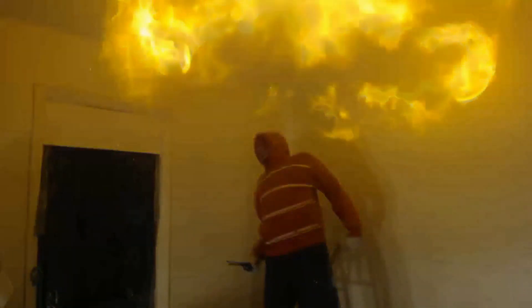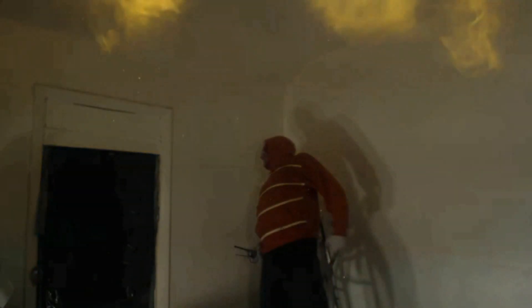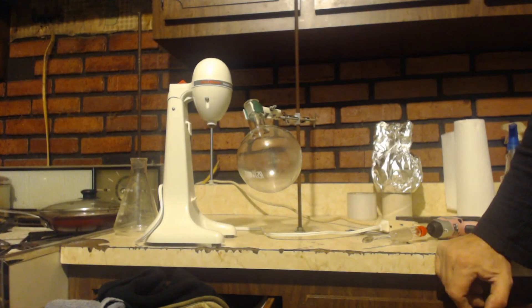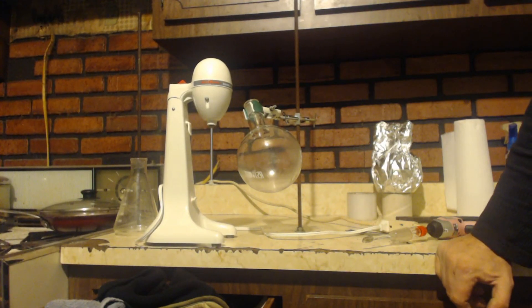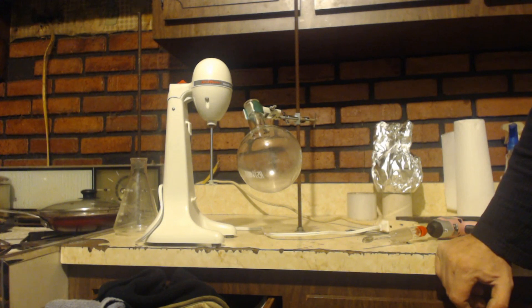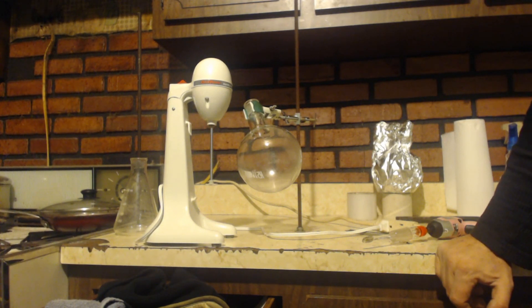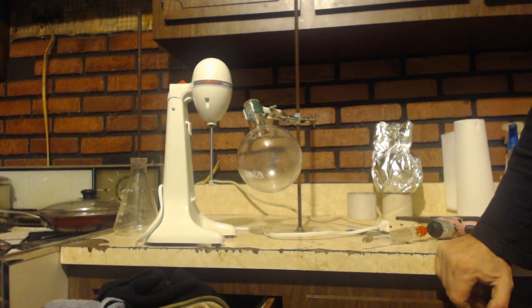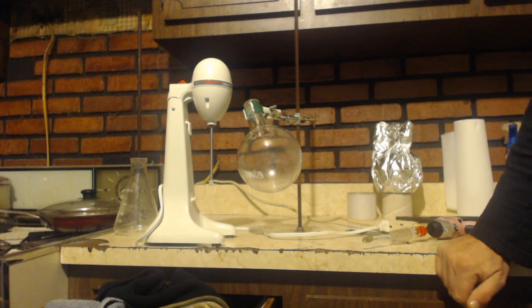So if you repeat anything in the video you do it at your own risk. Now if you saw my last video with the nitroethane, you'll know I need a mechanical stirrer instead of a magnetic stirrer.